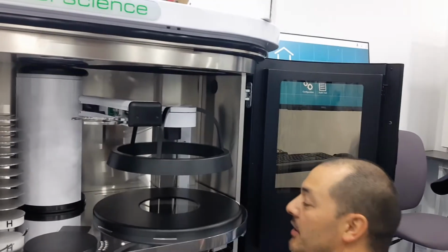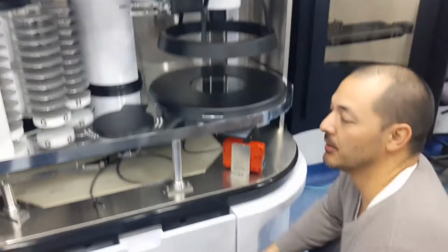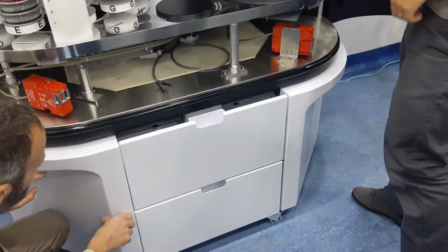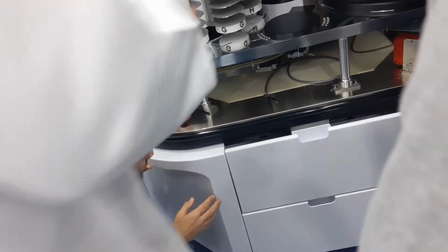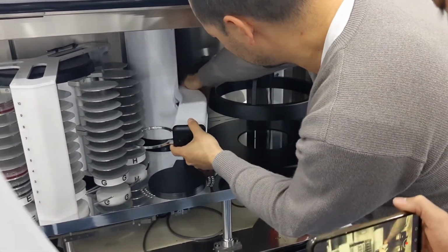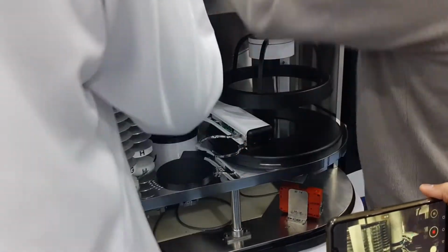Yeah. I think for servicing that's about it. We're done. So I'm gonna put the parts back. Gotcha. And that's it. Okay.